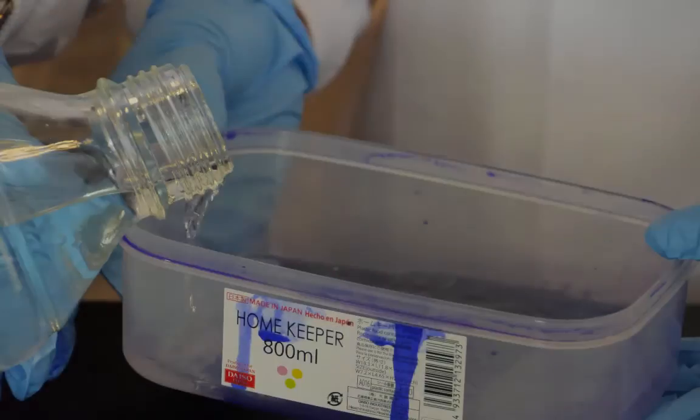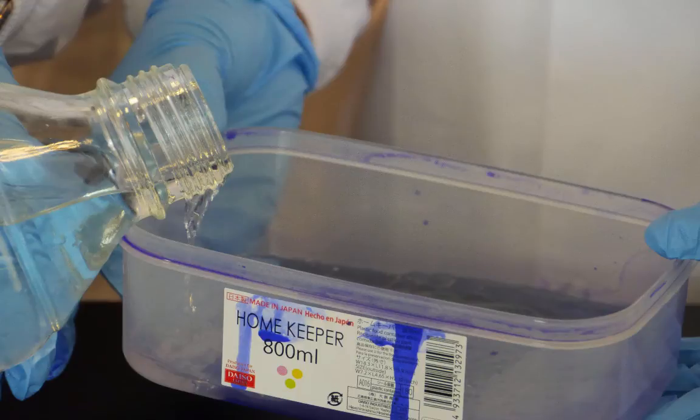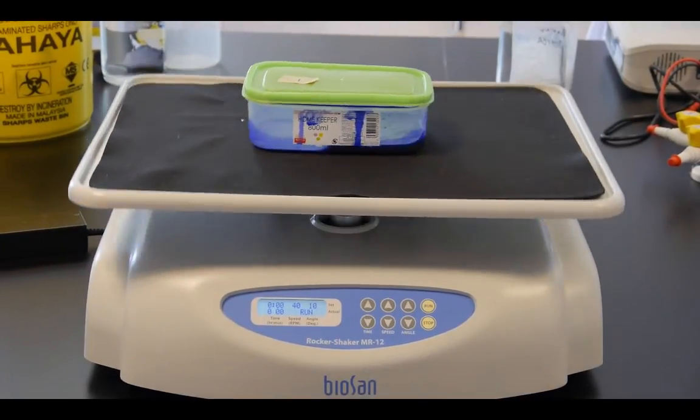Finally, the gel was de-stained for 20 minutes before visualizing on the DocuScan.